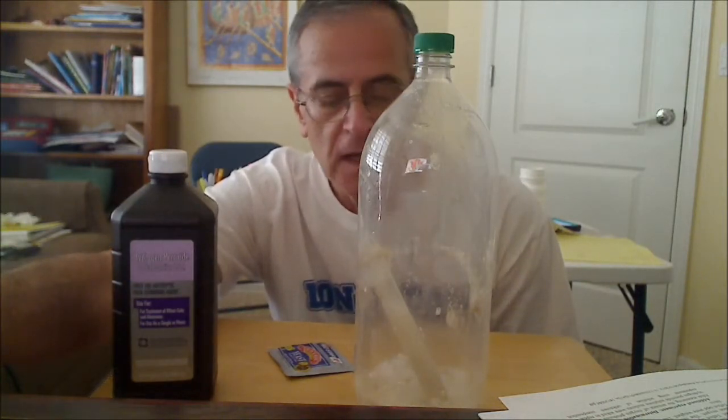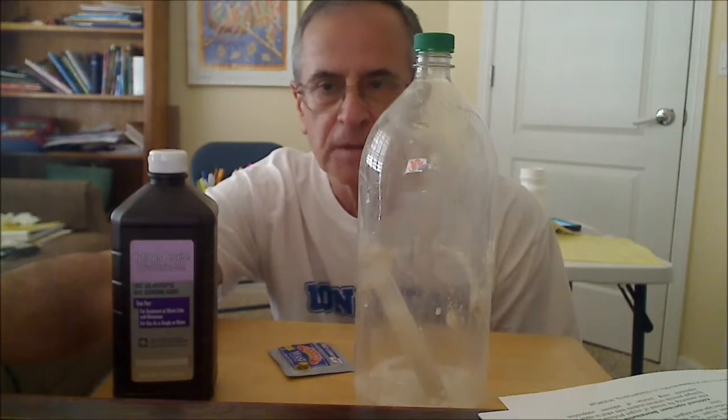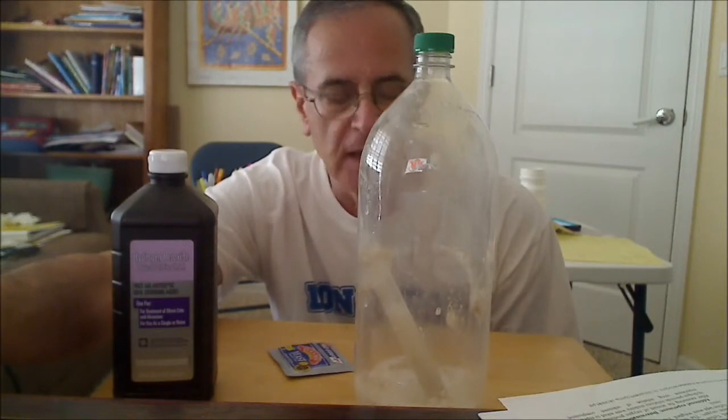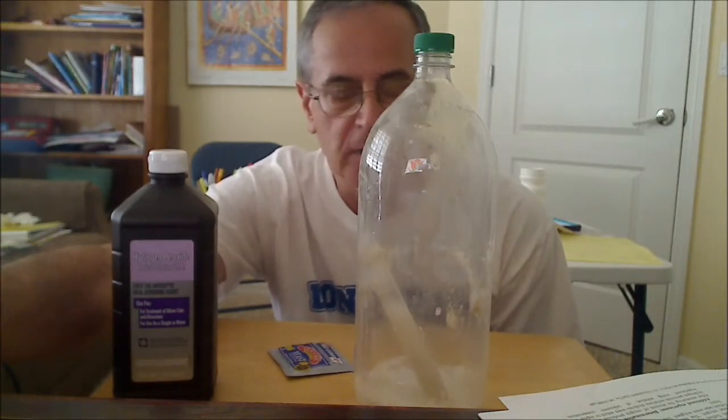As I said, I'm going to assume that there's 3 grams of hydrogen peroxide, 100 milliliters of 3%. It's going to be 3 grams. It's not that accurate, but as I said, you could do a titration and determine the exact amount.